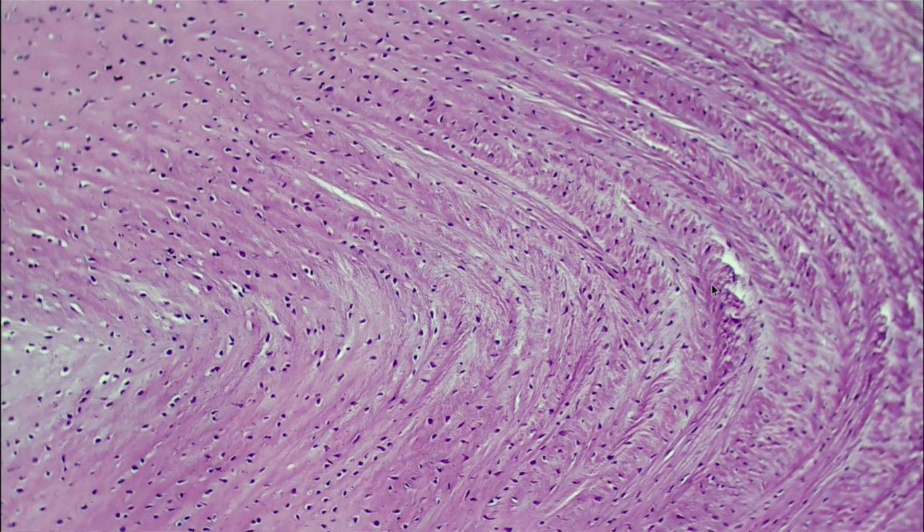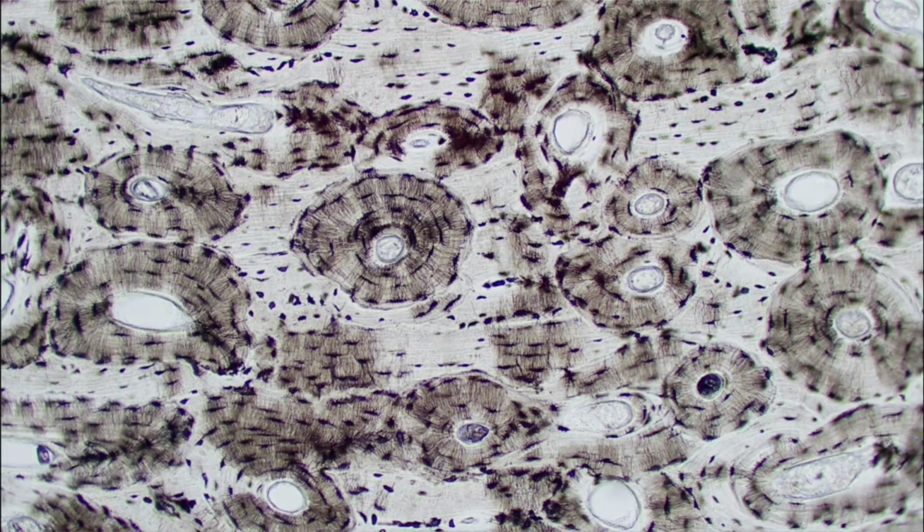All right, next we have fibrocartilage, and this is one I also definitely recommend coming into the lab to look at because there's lots of different areas on this slide. This is just one section of a much larger slide. This is one of my favorite slides actually, but we can tell, right, we have these ripples going on. We see lots of stuff going on here. It can be really confusing to look at. So I recommend coming to the lab and looking at this one. Again, this is fibrocartilage.